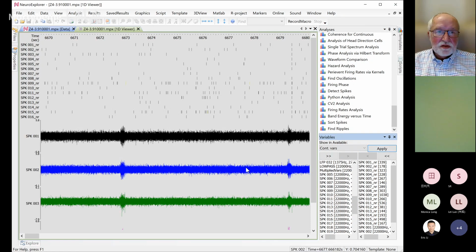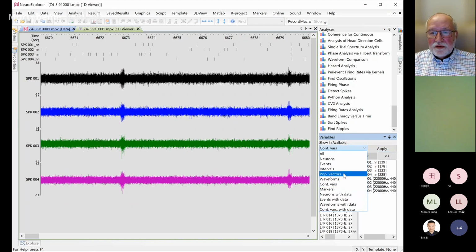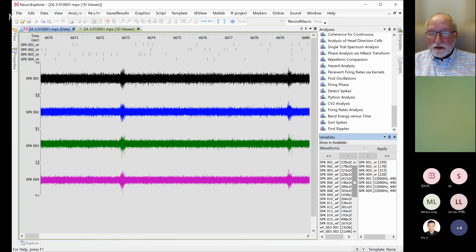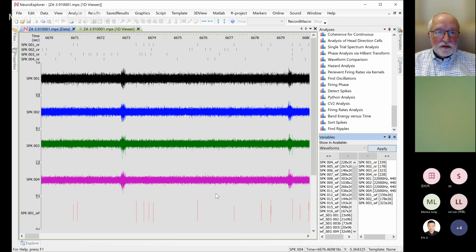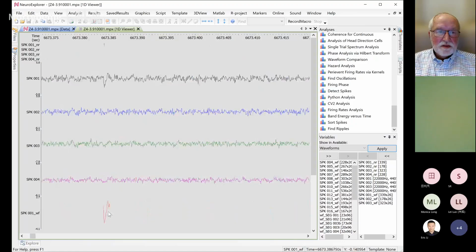This is all just visualization; it's not analysis. These are just the timestamps, or you can remove some of the spikes and just look at the waveforms. You can add the waveform variables, for example, this couple. Then you have to zoom in to one of the waveforms. So these are actually waveforms. This waveform corresponds to this SPK001 neuron timestamp.